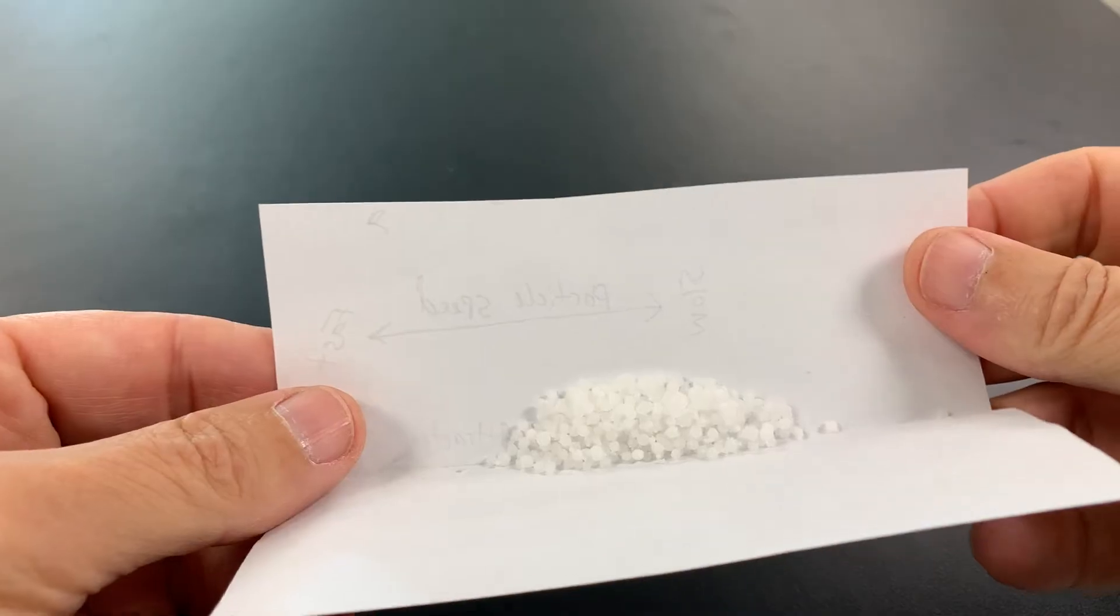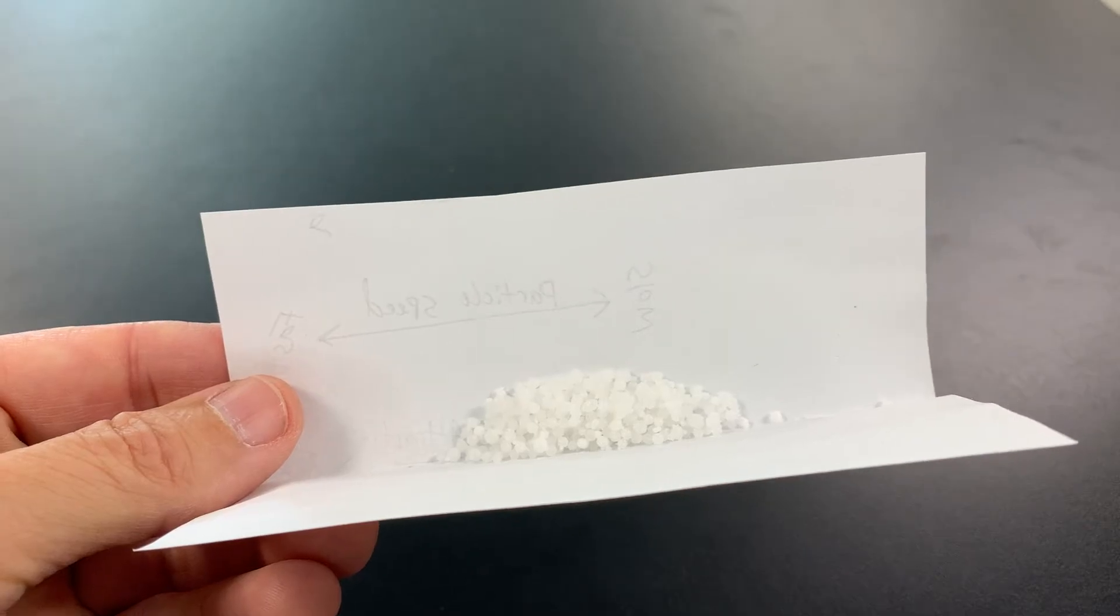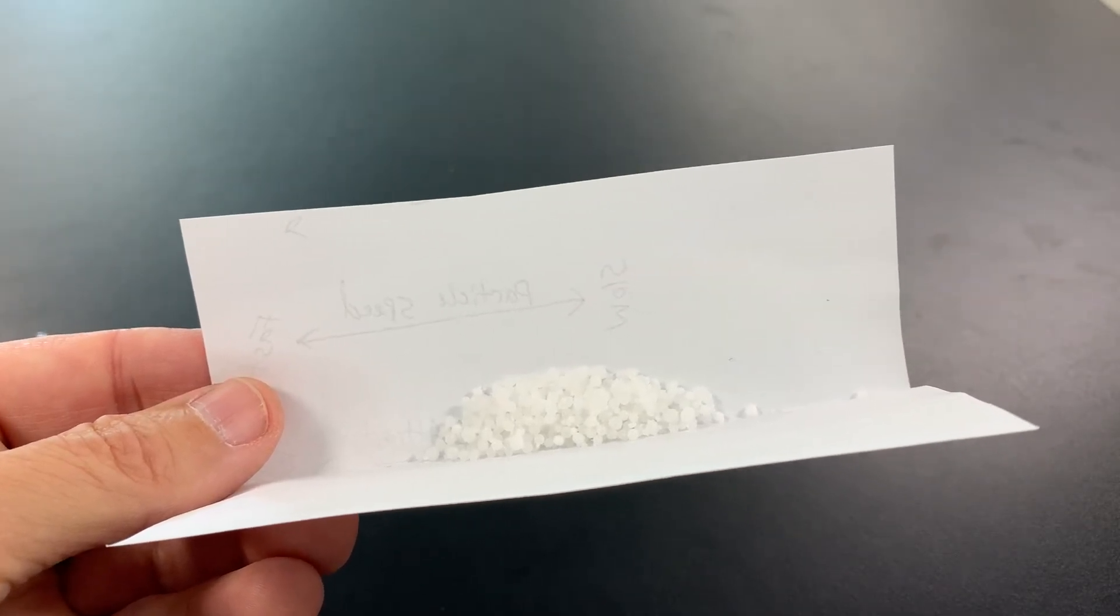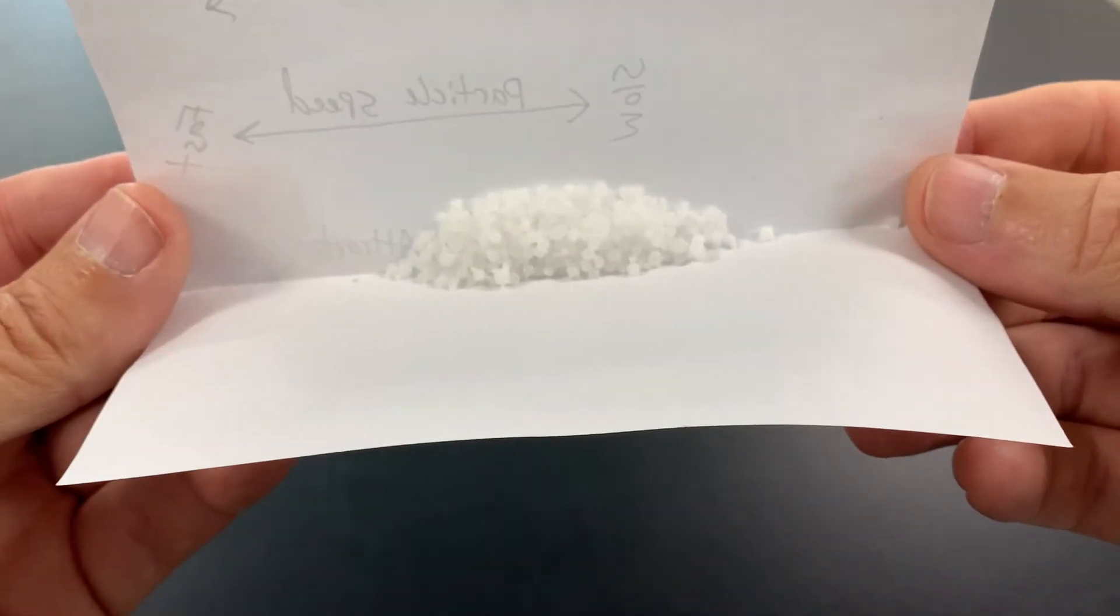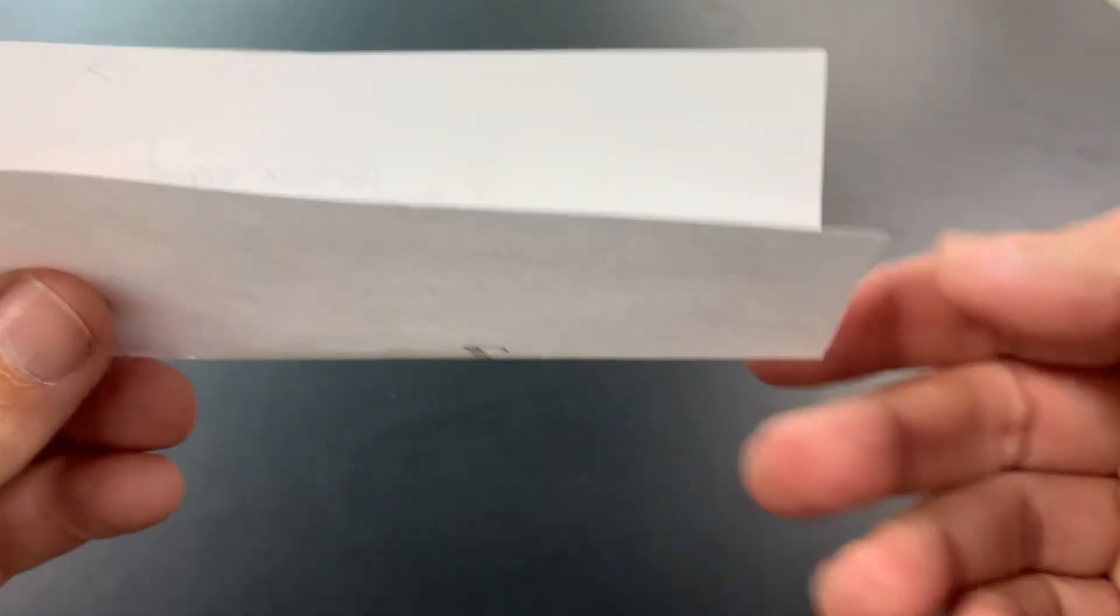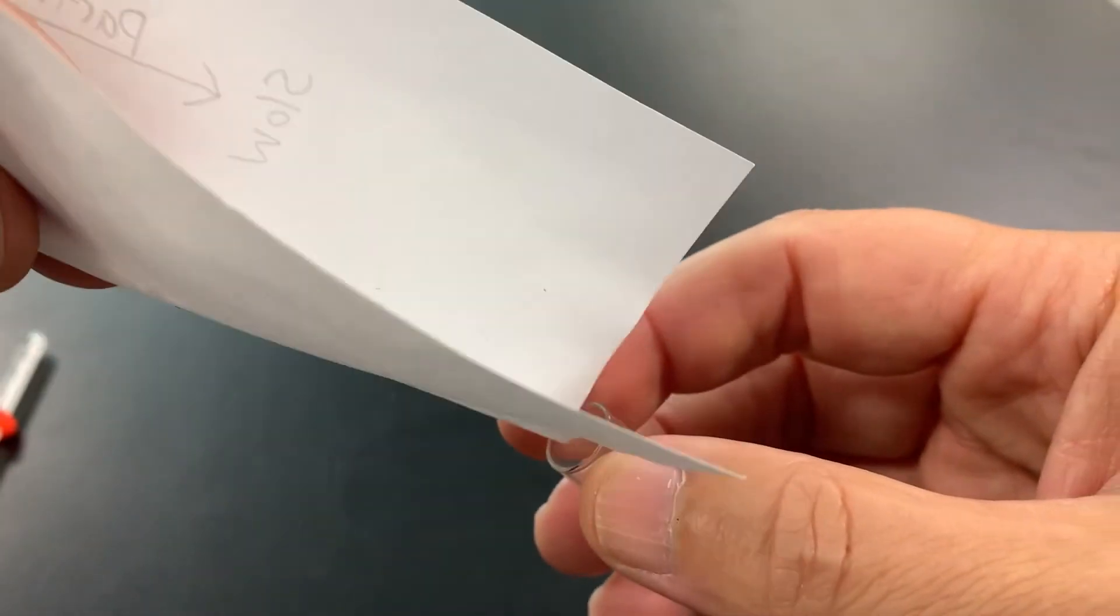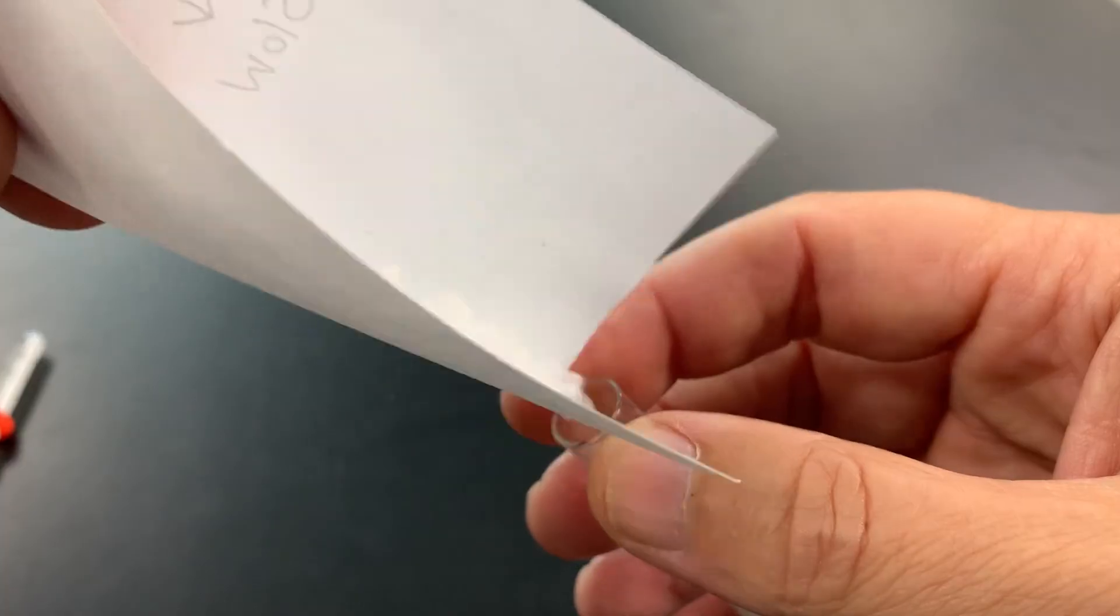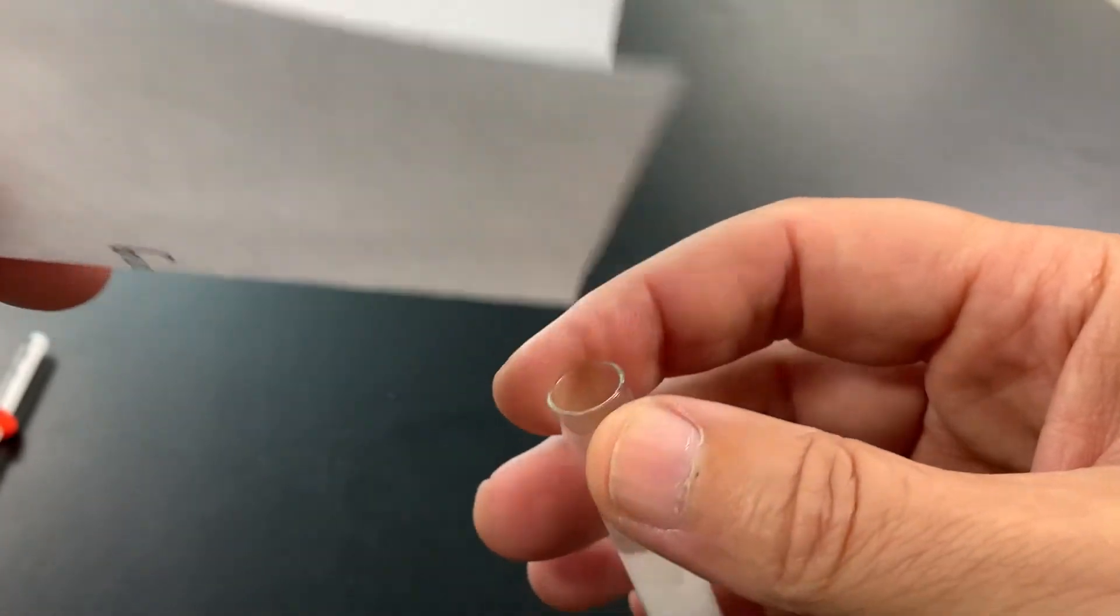Now I'm going to show you the chemical. The new chemical is ammonium nitrate. So, this is actually an ingredient in explosives. And by the way, getting calcium chloride and ammonium nitrate might be kind of challenging to buy. I had to buy them from a science supply company. But this kind of looks like Dippin' Dots also, but it's more translucent. It's a little clearer. And I'm going to pour it in the test tube just like I did with the other experiment.